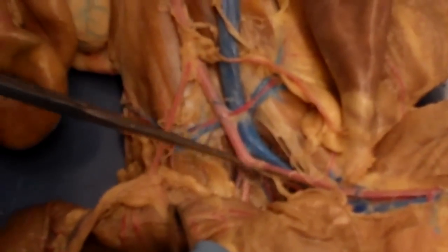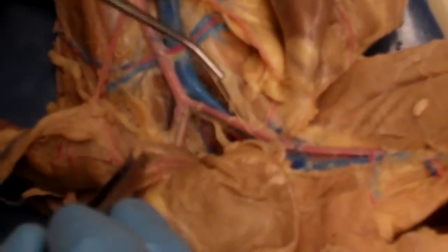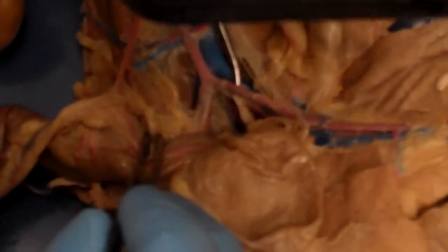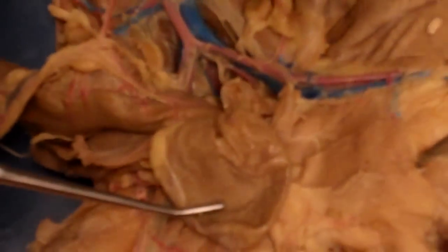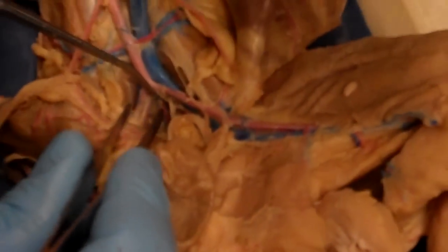And then what happens is you can see our abdominal aorta is going to terminate by first splitting into a Y, and we can see the Y right there. The big part of the Y is going to be the external iliac arteries. And you can see the external iliac arteries are going to go down and ultimately supply the left and right limbs.